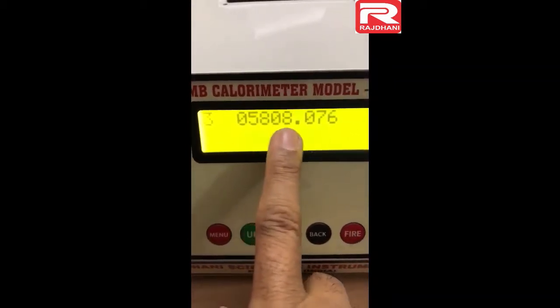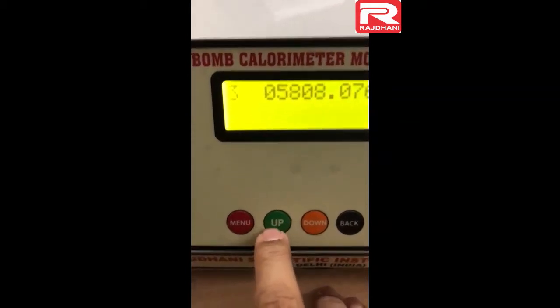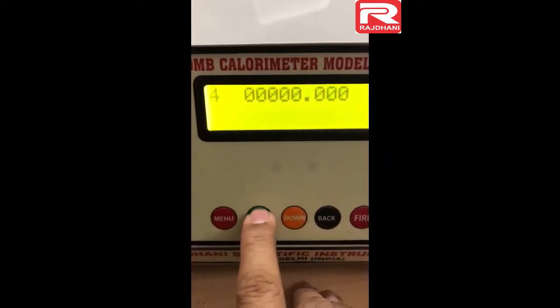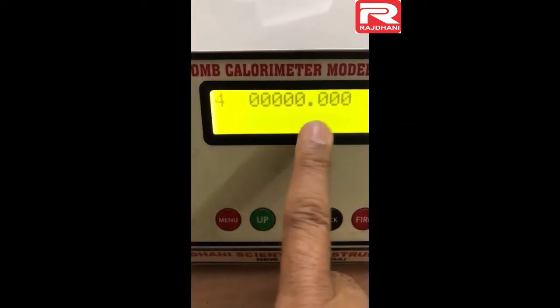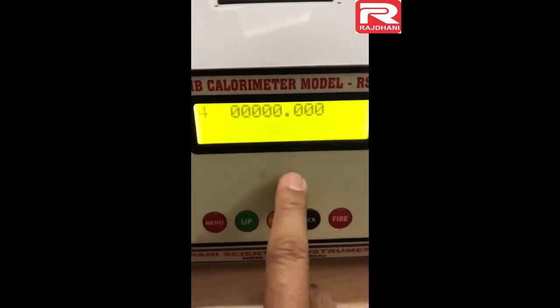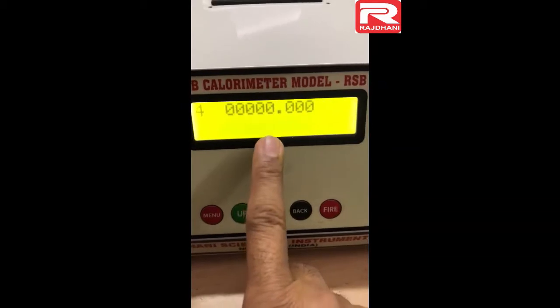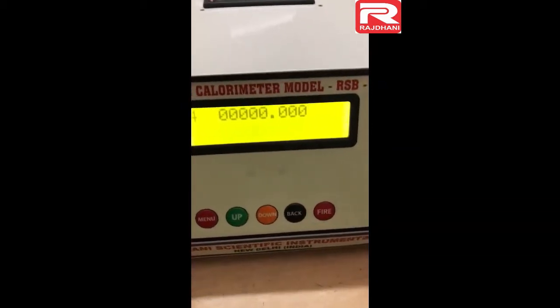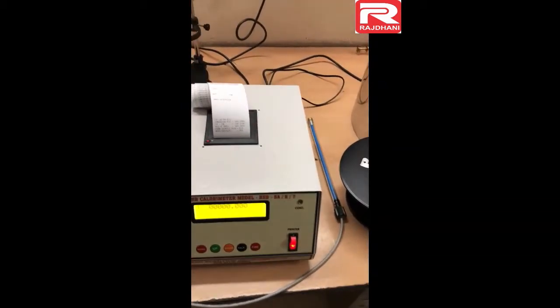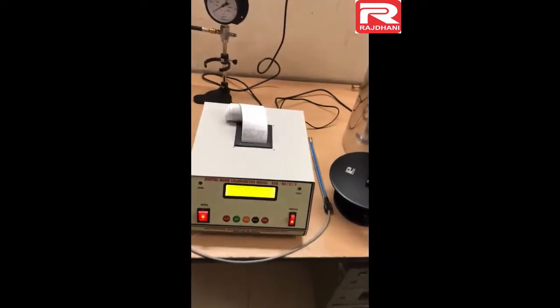If I press the up button it shows memory location 4, which is currently empty. Whatever the next result is, it will be saved to location 4, and so on. This is all about model RSB 7.